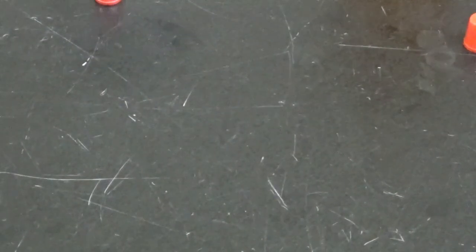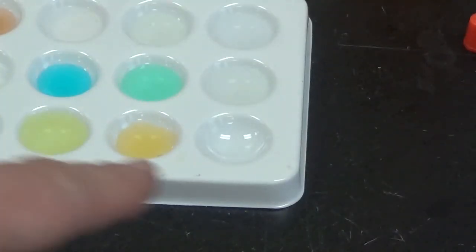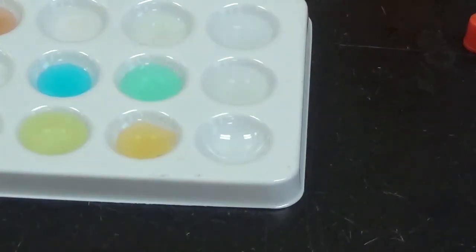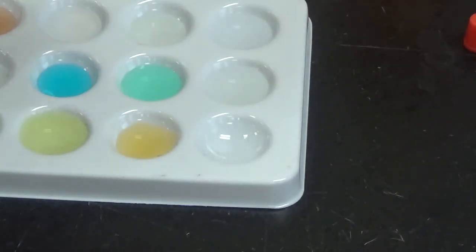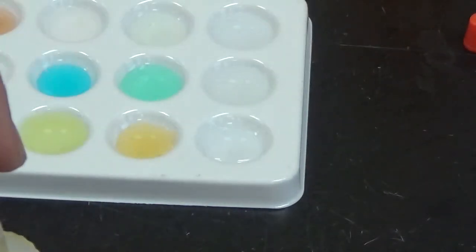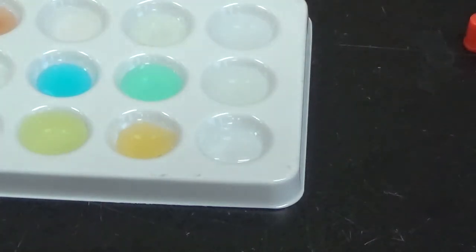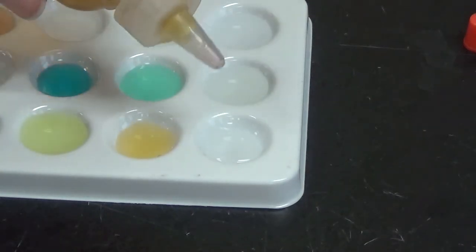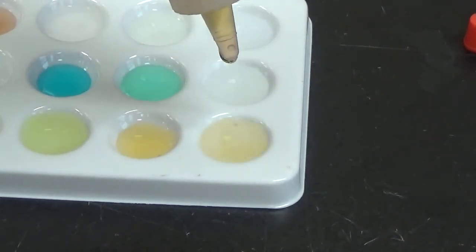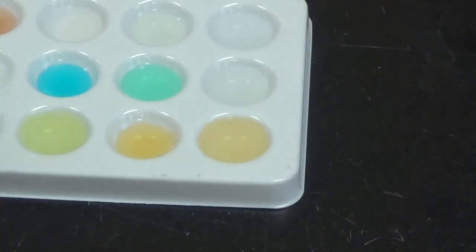We are going to reuse this tray right here, but we are only going to focus on this well right here. In this well, I'm going to add lead 2 nitrate, so a clear, colorless liquid. I'll put that one away. And to it, I'm going to add the iron 3 nitrate. So nothing there but a color dilution. Alright, so that is mixing all of the reagent solutions that we had to.